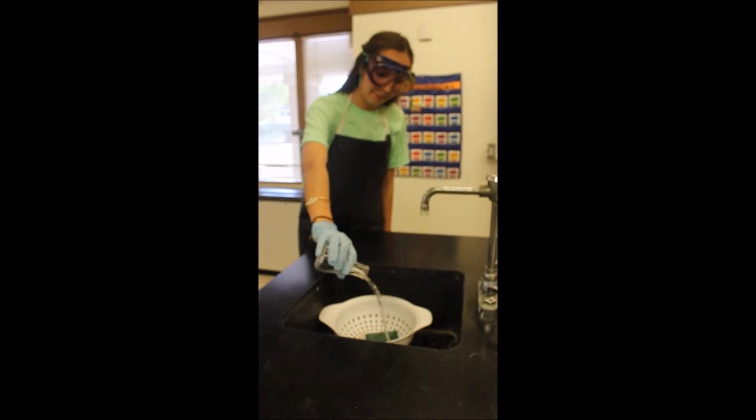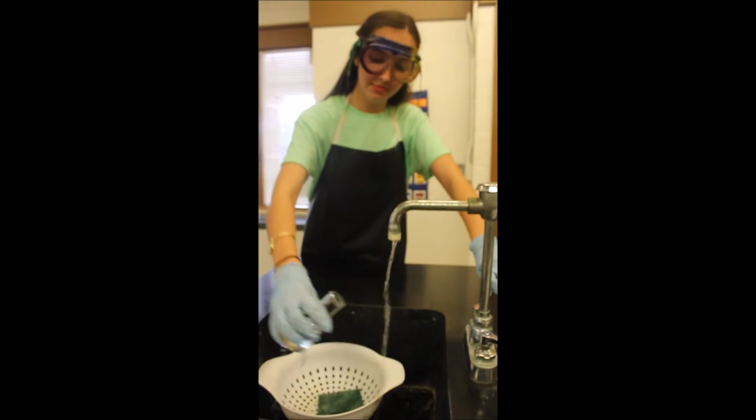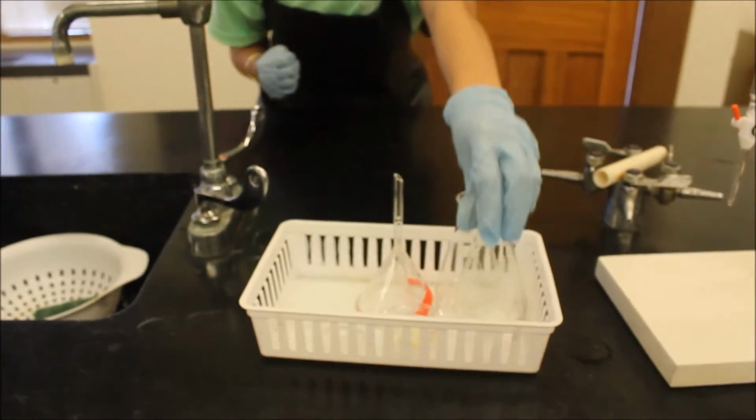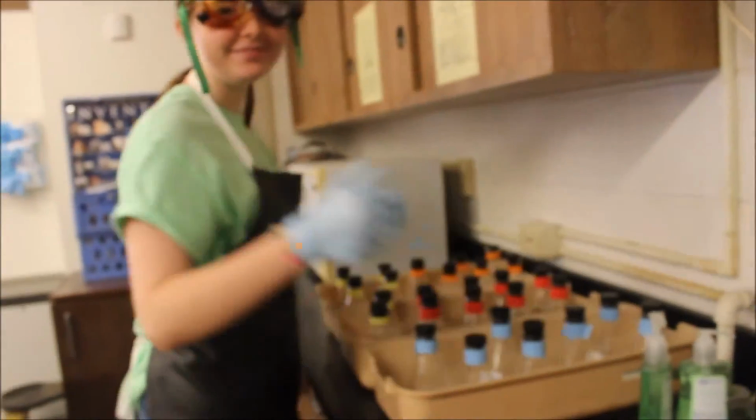After all measurements were taken, the flask's contents were dumped down the drain to clean the flask. The burette and titration setup was cleaned and all materials were put back in the correct places.